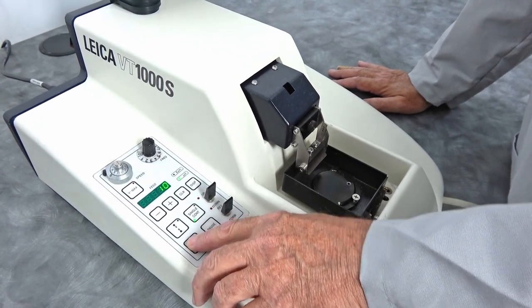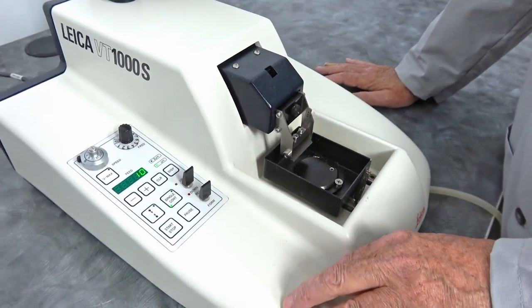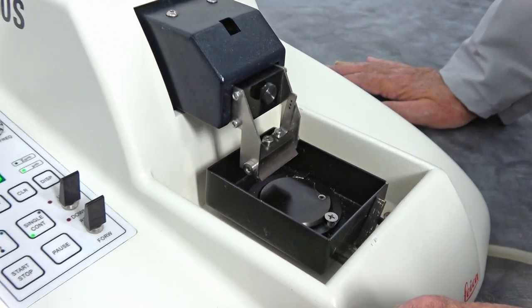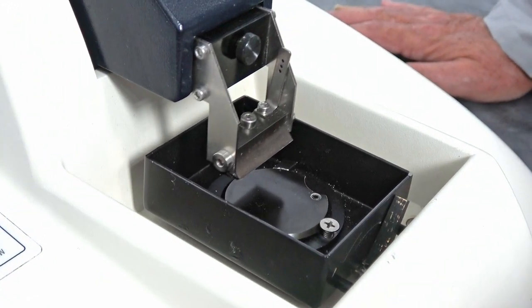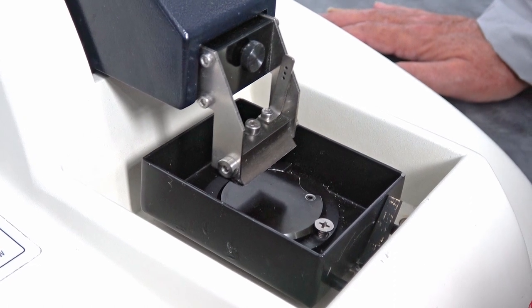Simply press the button and it starts. As you can see, we have that set at a fairly high speed. When it's set to lower speeds, you almost don't see it move.